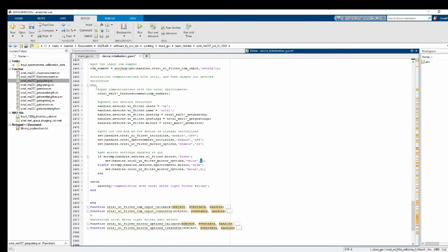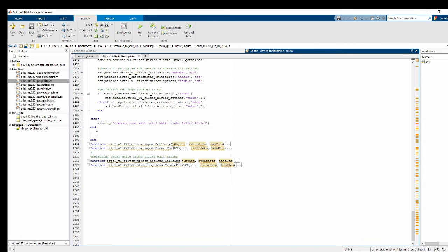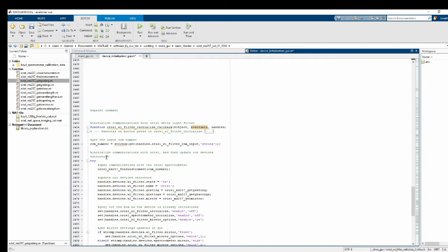And then if that doesn't all work, then we get a catch and a warning: communication with the oriel filter failed. And then after that, just two generic lines of code basically. This one, whenever you make a GUI in MATLAB, you're constantly doing this GUI data update thing, because it's sort of like a global variable that you have to be able to update externally. And then after that, set this back to ready to let the user know we're done working.